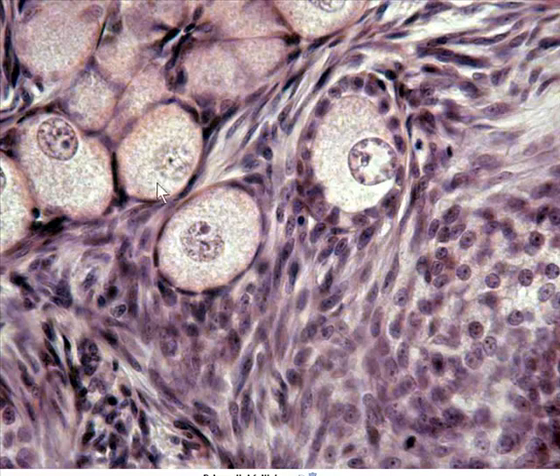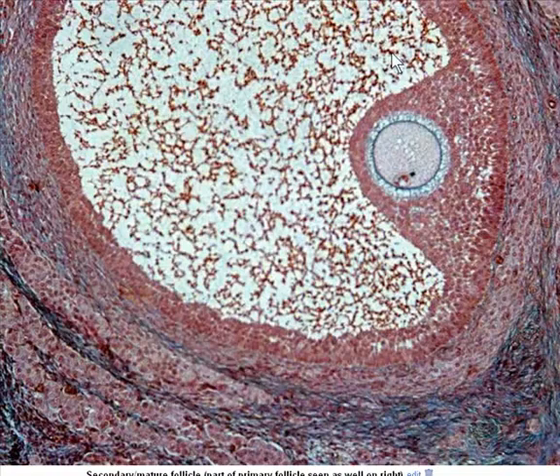So again, here are primordial follicles through here. This one right here is on the transition of becoming a primary follicle. You can see cuboidal shaped follicular cells surrounding it. It's getting a little bit larger. Here's a good primary over to the right side of this one, but mainly a secondary that we see here. And again, we see the fluid-filled antrum.